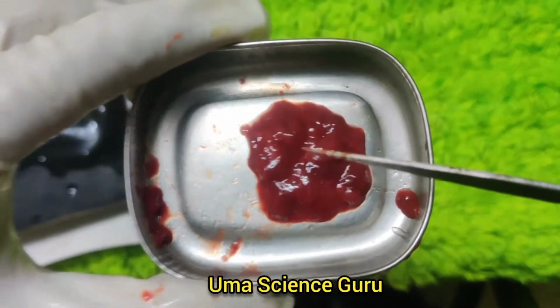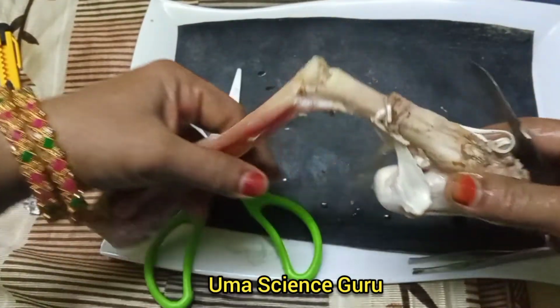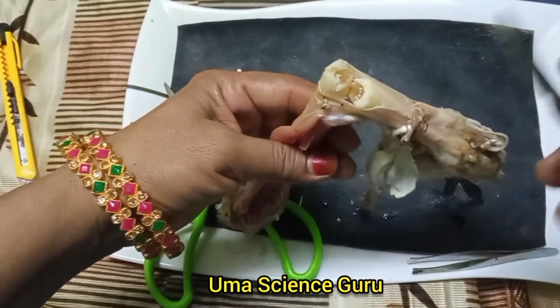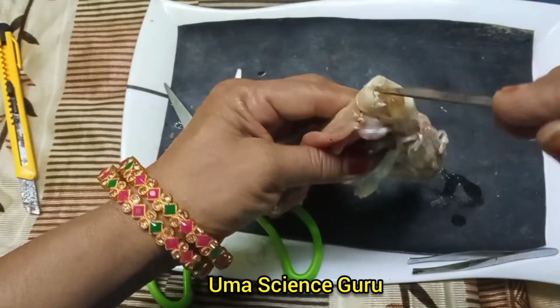Students, you observe another video. I am trying to separate the yellow marrow from bone. There are some key differences between red marrow and yellow marrow. Yellow marrow is present in long bone.